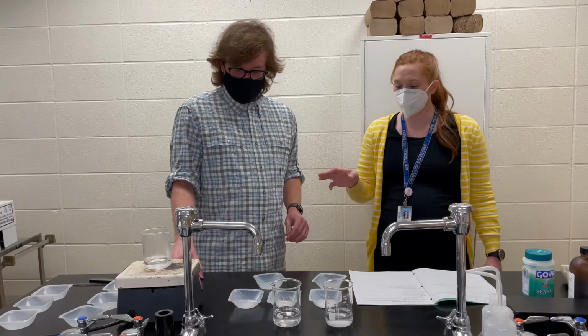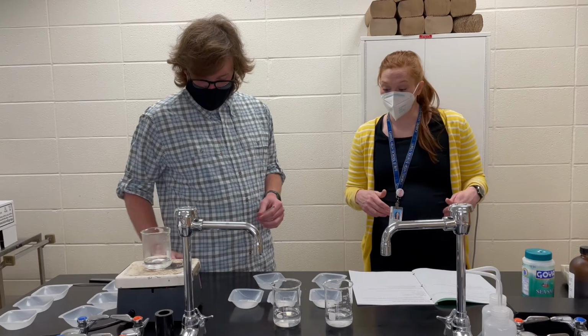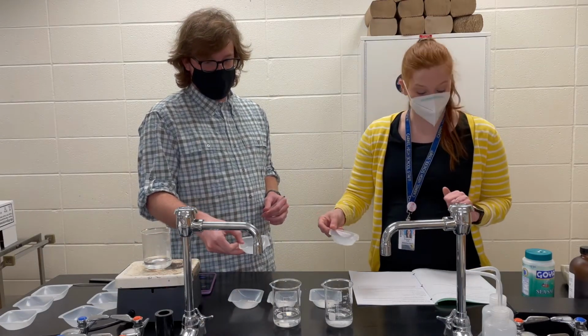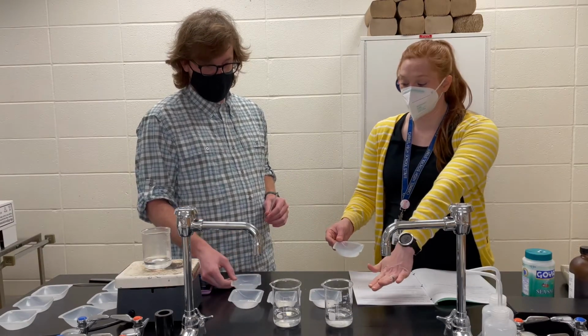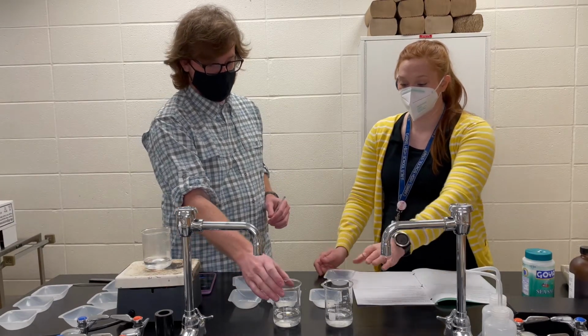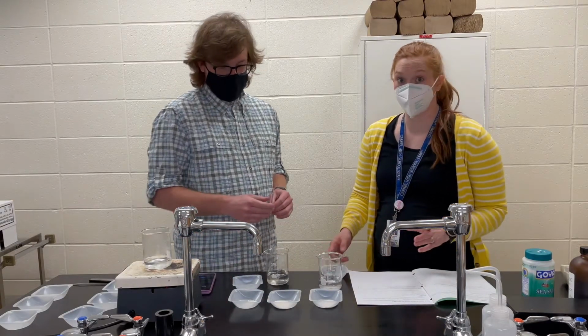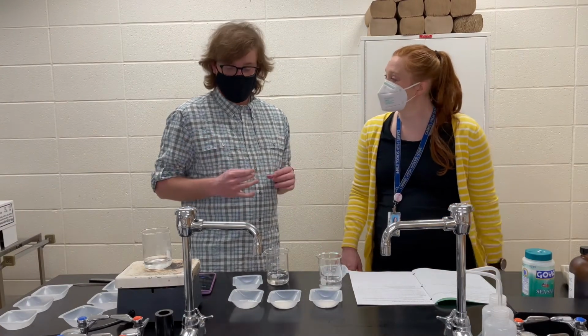So, Mr. Sharkey is going to be the stirrer. I'm going to be the non-stirrer. We both have equal amounts of the same size salt crystals, which is 0.25 grams. And we're gonna put this in our room temperature water. So the amount of salt is the same, the amount of water is the same, and the only difference is Sharky's gonna stir, I'm not. We're gonna go until we can't see crystals anymore.